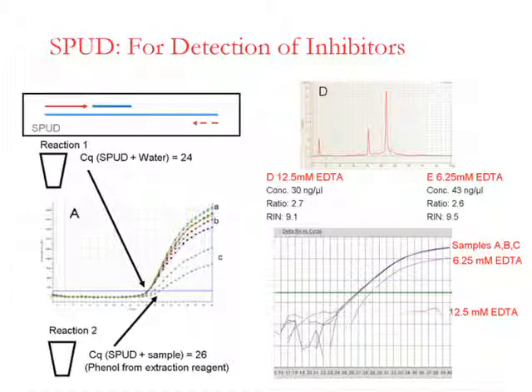On the right-hand side, you can see a sample that apparently, according to the Agilent Bioanalyzer analysis, is of high quality. However, we know that during the preparation of this sample and one similar, a concentration of EDTA was added, and this was done to simulate the effect of an inhibitor within a sample. And you can see that the effect of the EDTA on the SPUD assay is to inhibit at fairly low concentration by 2 cycles. When you double that concentration, you can see that the assay is completely inhibited such that it fails completely. So this also indicates that the effect of an inhibitor in a sample is not linear.